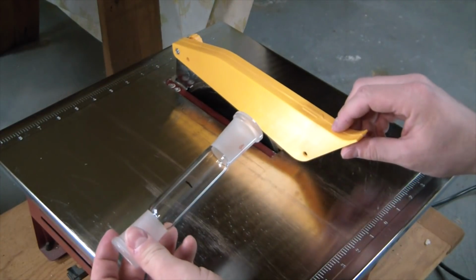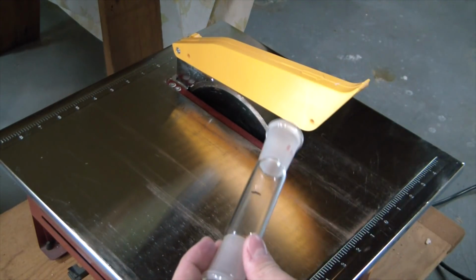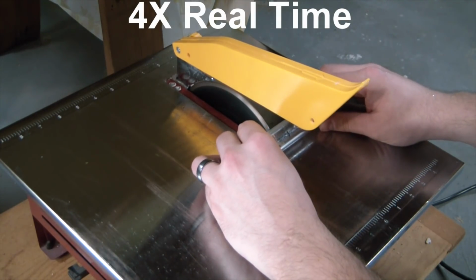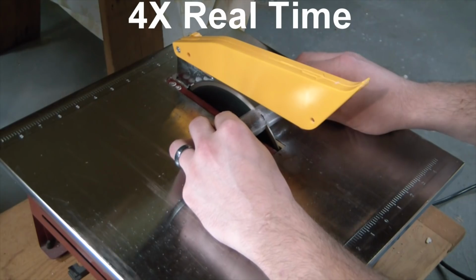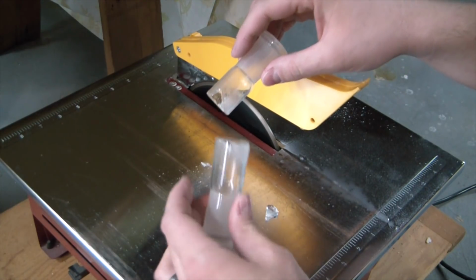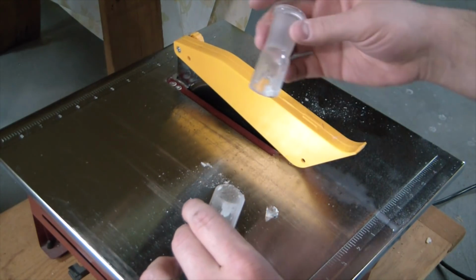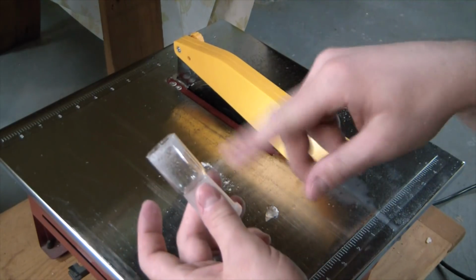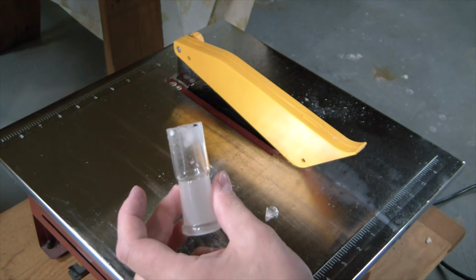Got the glass piece marked halfway, so I'm gonna have to flame polish the rough end after this, but let's hope it's a good cut. Oh, well, that's a bummer. One side cracked. Shit. I was hoping to keep that as a backup. Might still be usable, but I'm gonna clean this side up and try to flame polish it. I might sandpaper it first, just to clean it up.